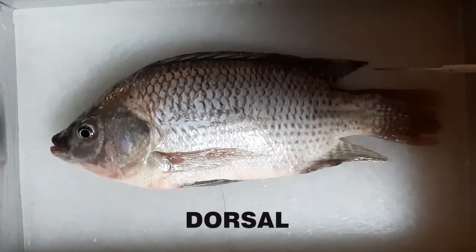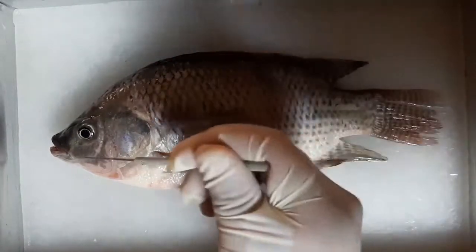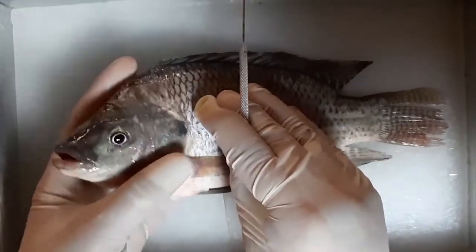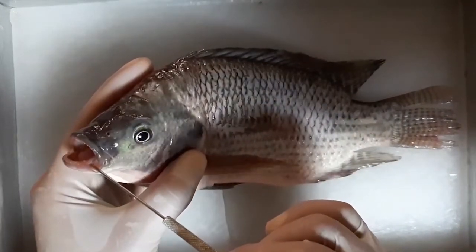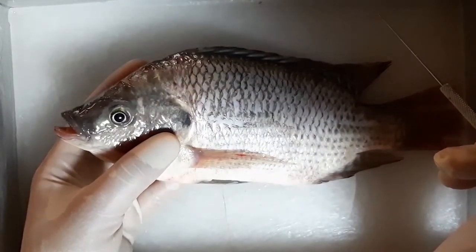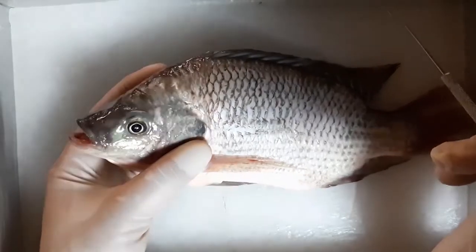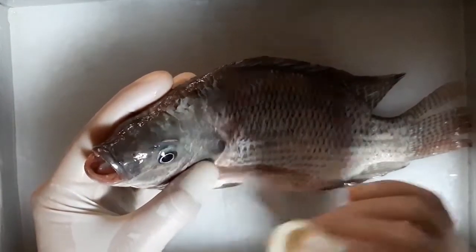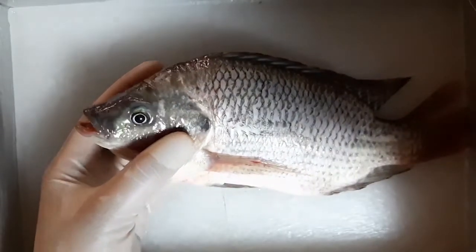This is the dorsal, the ventral, the anterior, and posterior. In the anterior end of the fish is the mouth. The fish uses its mouth to take in water for breathing and to take in food for eating. Behind the mouth on the dorsal surface are the two nares, which are used for sense of smell.